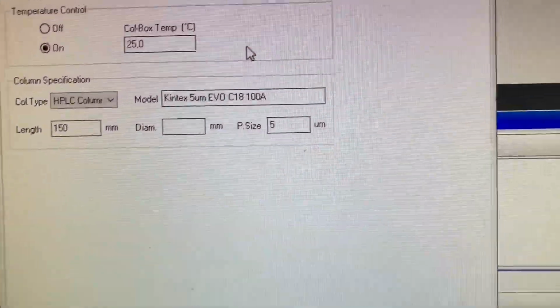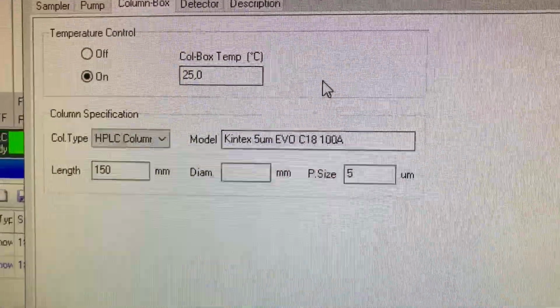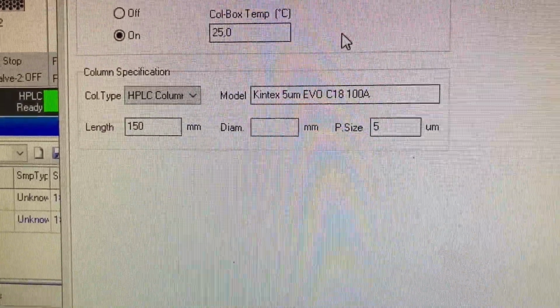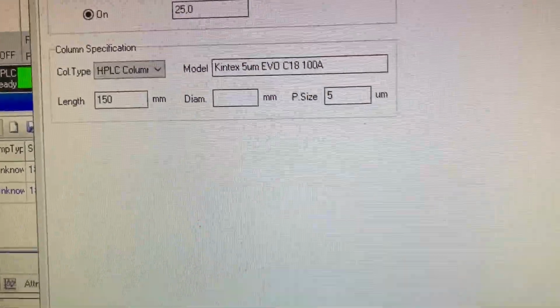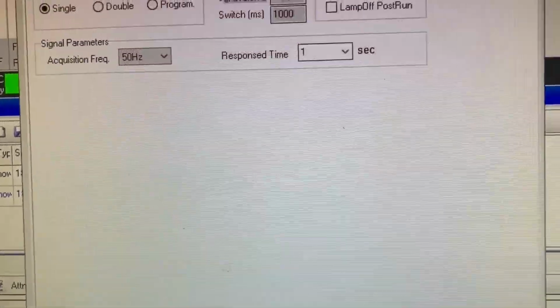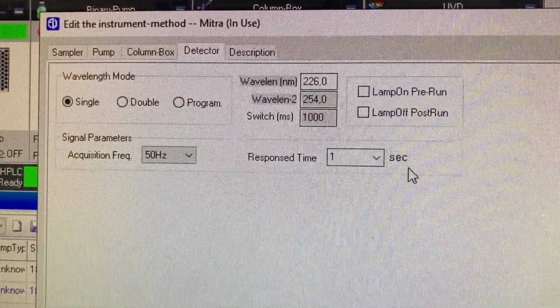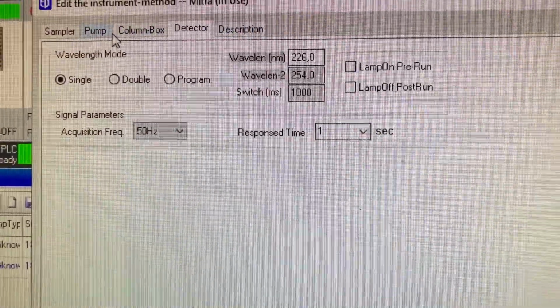And the column box, it's got the temperature, the column type, the detector, the wavelength, all the settings are there. Just keep it like that. Can't go wrong.